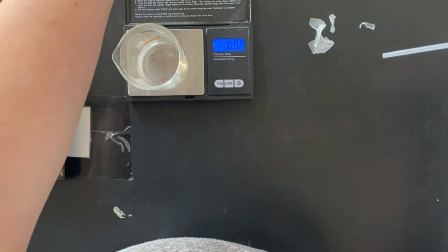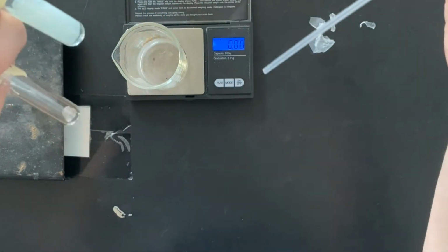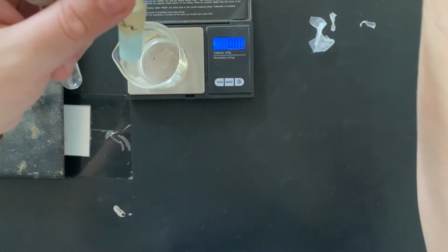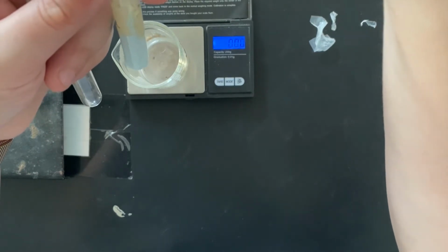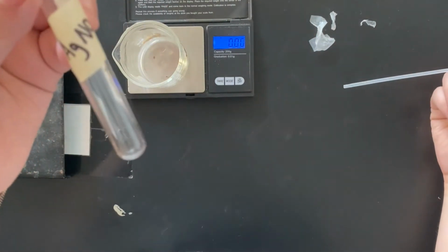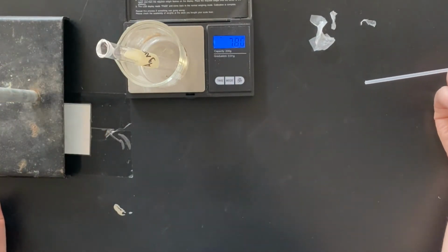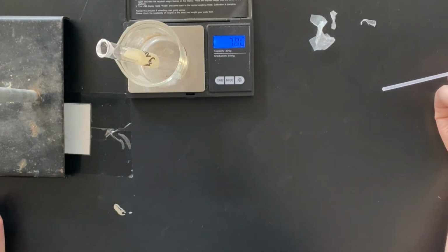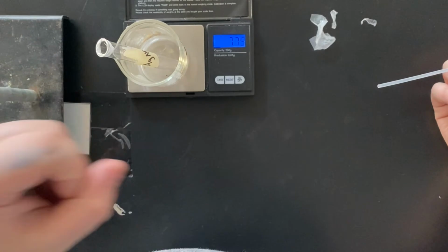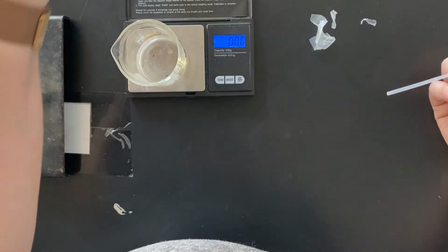Give that to a lab partner to hold, and then slowly add it into the copper chloride one. When you add it in, a reaction will happen, and you'll be able to see what is going on. So you're going to add all of your silver nitrate in there. Give that a second, let that sit. And then now that you have this empty silver nitrate tube, what you're going to want to do is take the mass of the empty tube. This is 7.80 grams. So now that you have the empty mass of the test tube, you can pull that into your data table. And then following the instructions on there, find the mass of just your AgNO3 and just your mass of copper chloride.